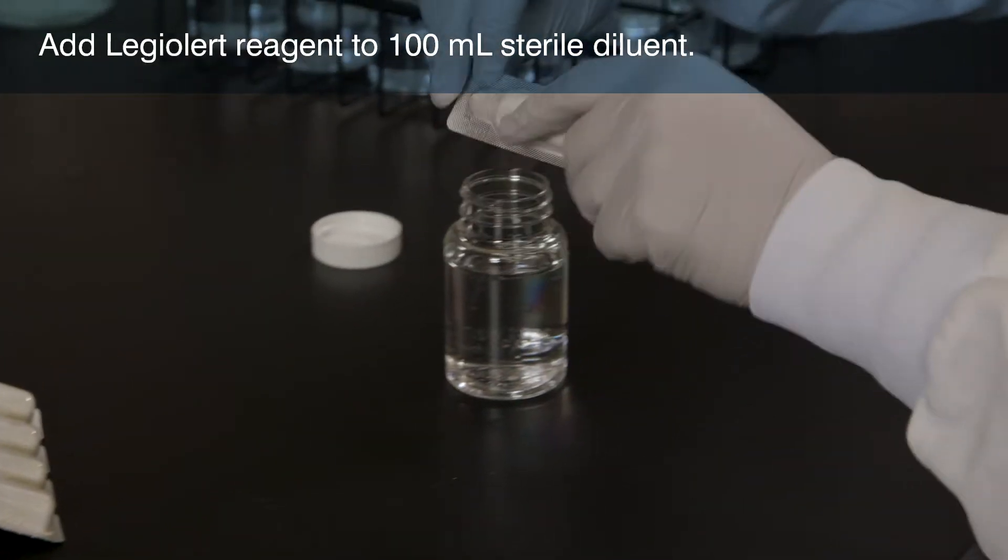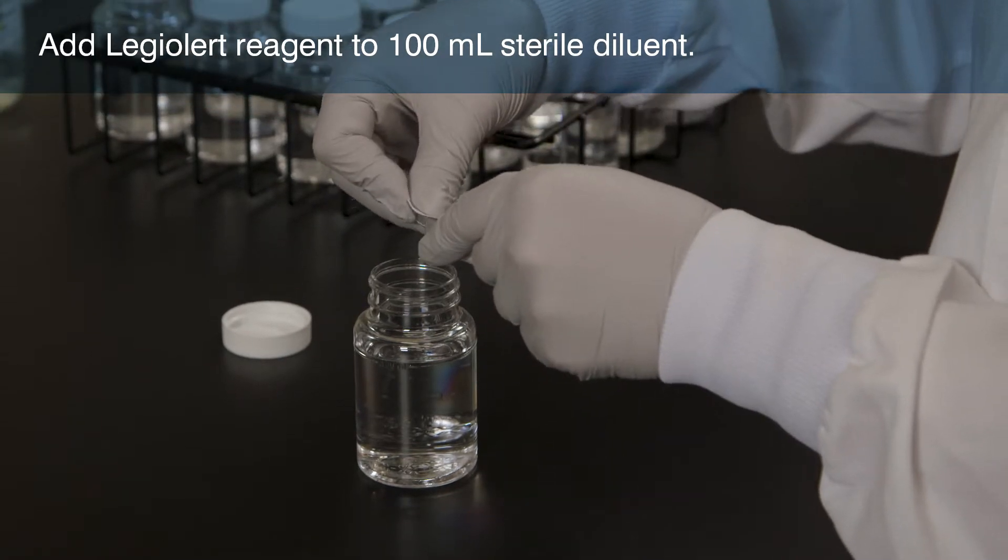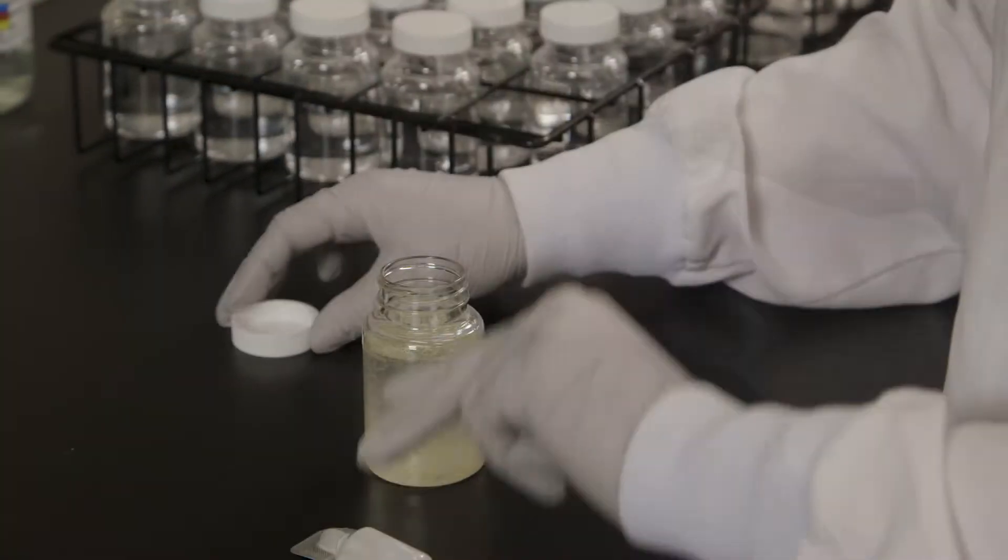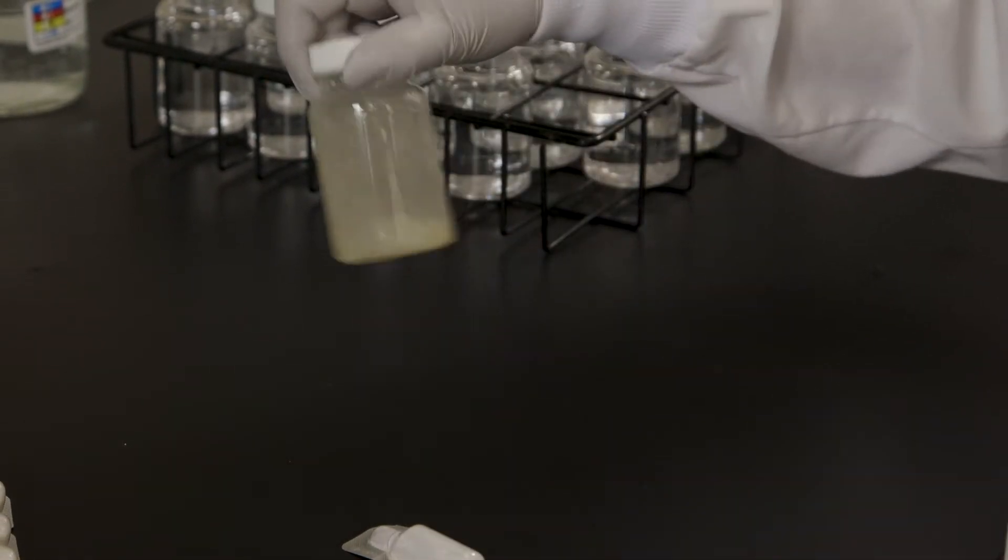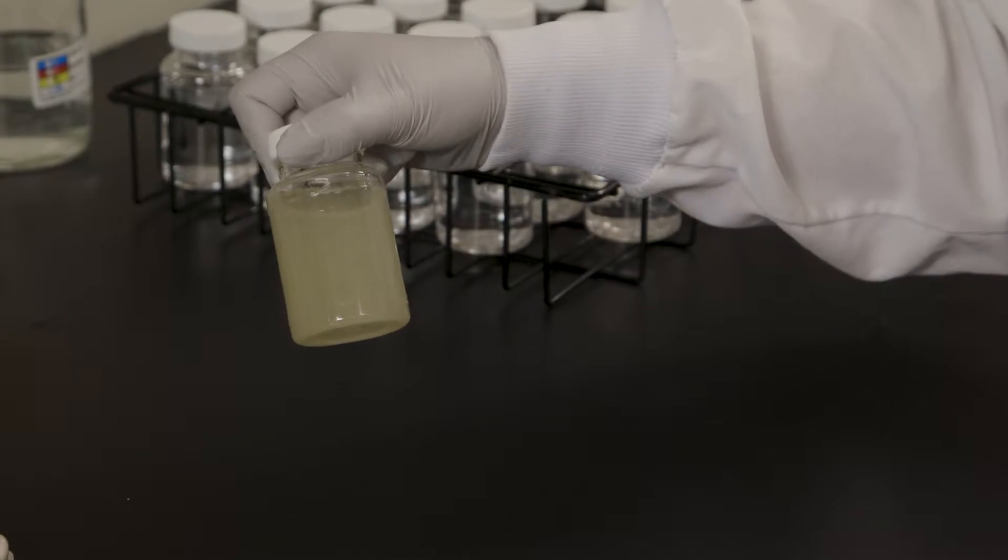Snap open the reagent pack and pour the powder into 100 mL of sterile diluent. Cap the vessel and shake until the contents are dissolved. The water may remain cloudy. Set this vessel aside.